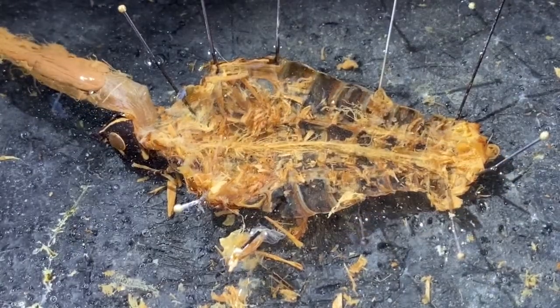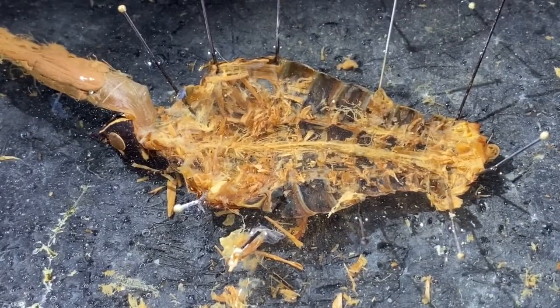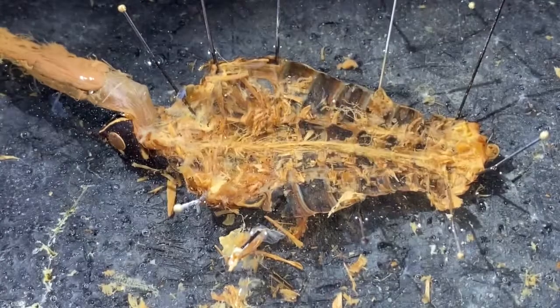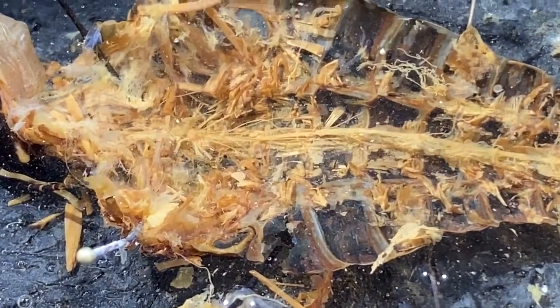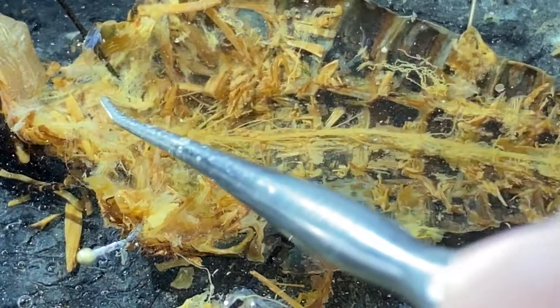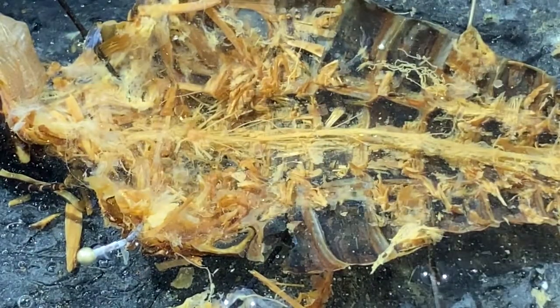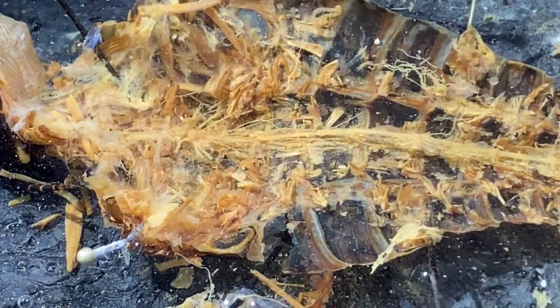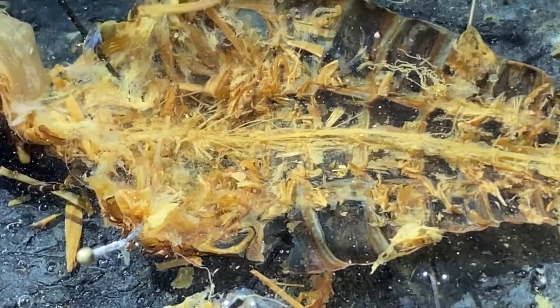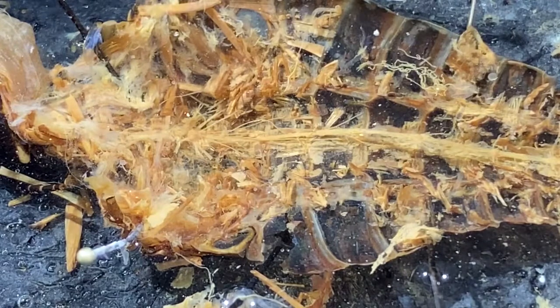Okay, so I went in and removed the peritoneal lining of what was the hemocoel so that you can see more clearly the ventral nerve cord on these animals. So I'm just going to zoom in a little bit more here. You can see in the anterior part, now you can't see it in this preparation, but there is a brain, and it is dorsal, so we have supraesophageal ganglia up here. We have the three-part brain of the insect.